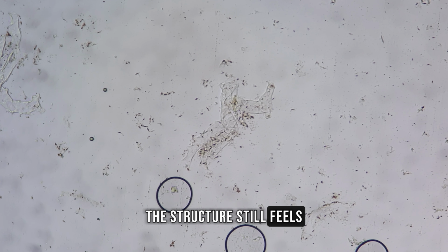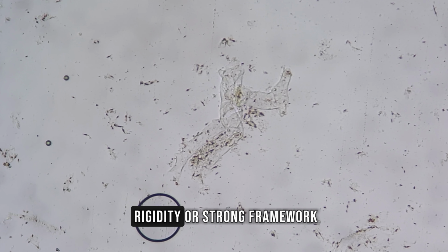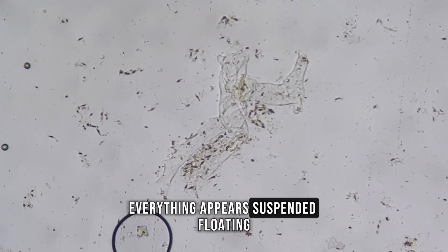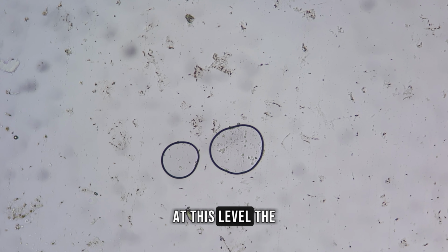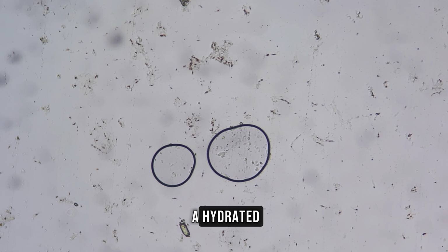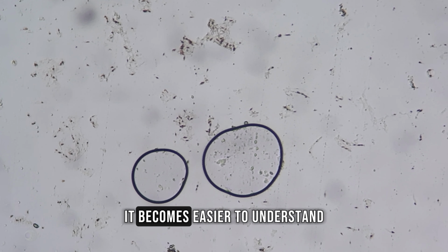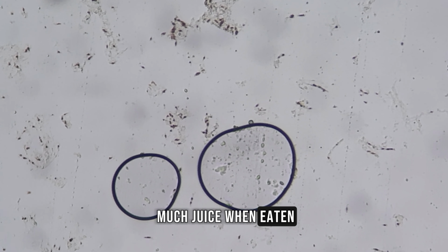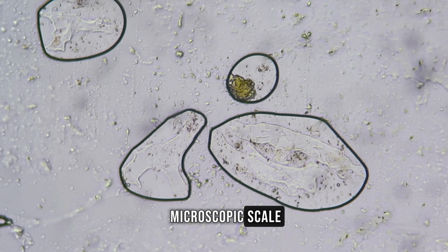The structure still feels extremely delicate. There's no sense of rigidity or strong framework. Everything appears suspended, floating, and loosely connected. At this level, the mandarin begins to resemble a hydrated system rather than a solid object. It becomes easier to understand why mandarin releases so much juice when eaten. The fruit is already breaking apart at a microscopic scale.